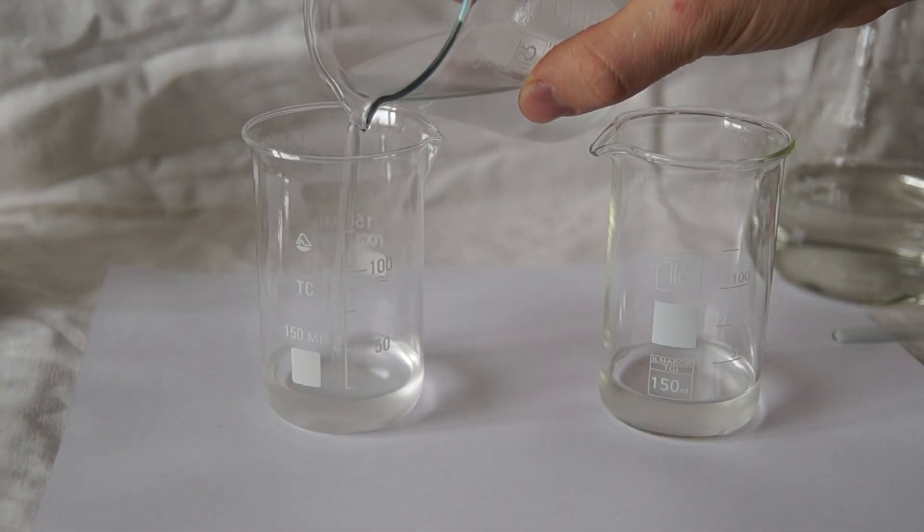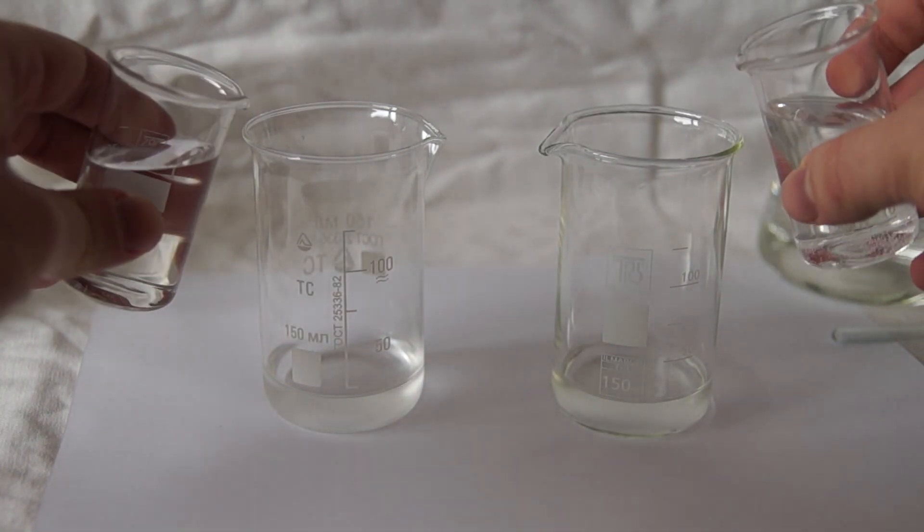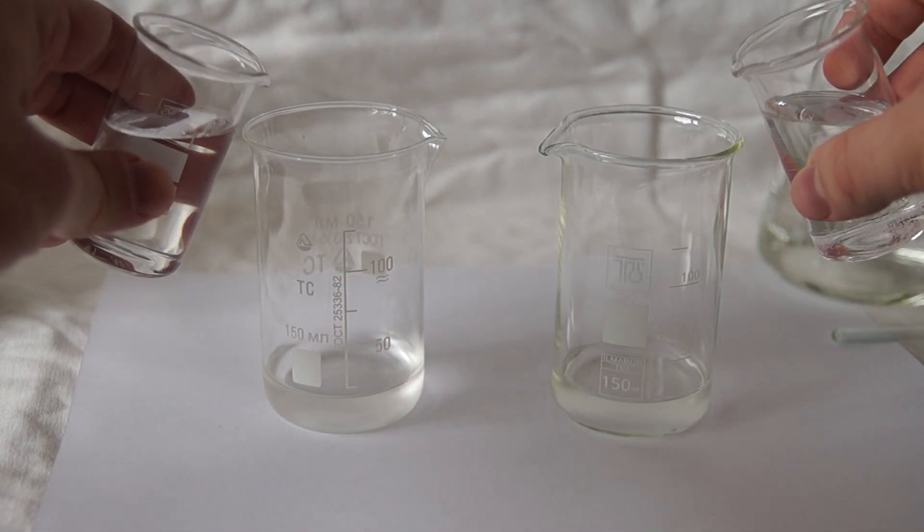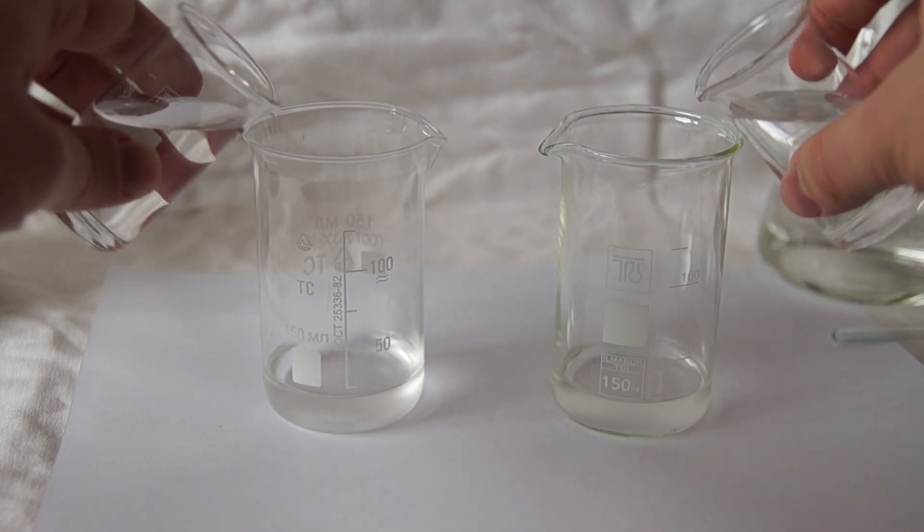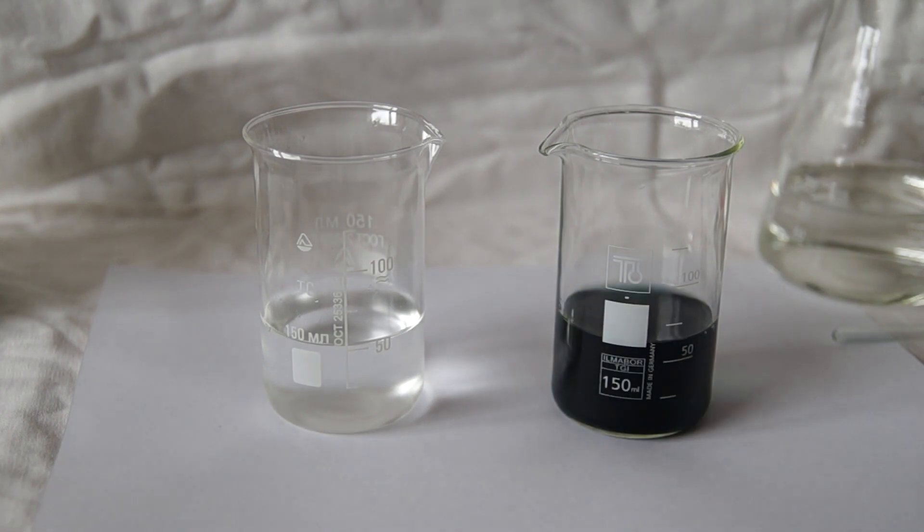Now, however, the second solution is with different concentration and the reaction time can change. One, two, three and mixed solutions. The first solution reacts rapidly, but the second one is a bit longer.